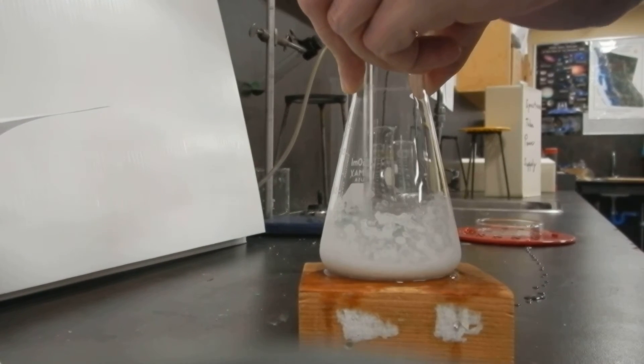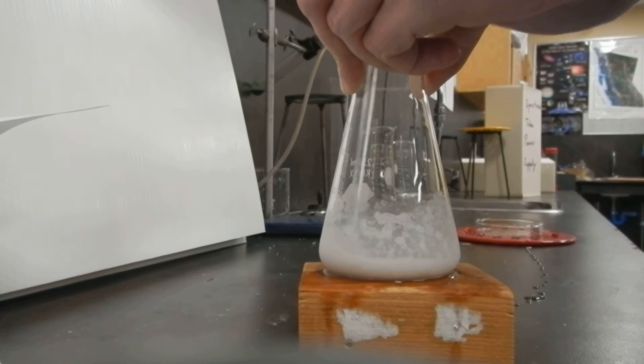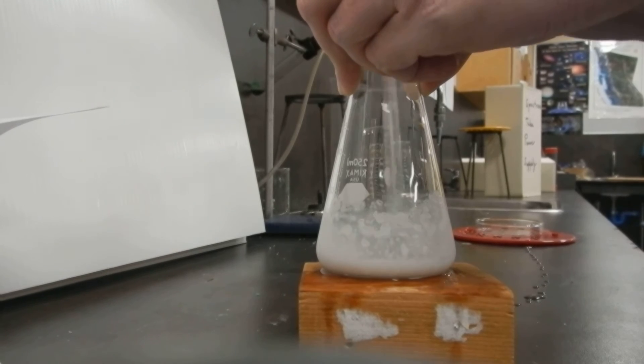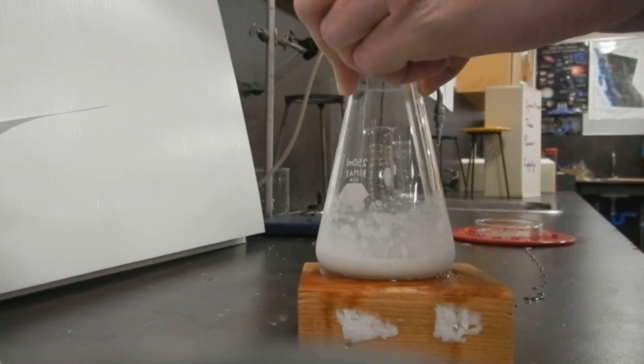And as I mix this, the two solids, and one of the products is turning things to a liquid. Someday I'll have to show you this equation.